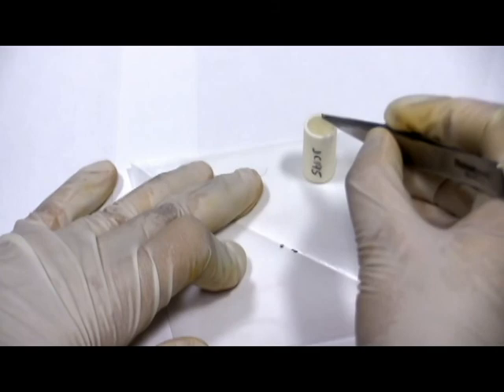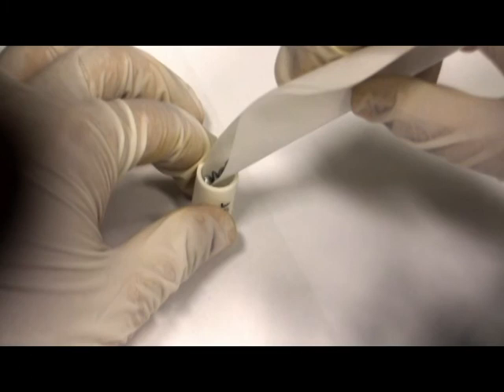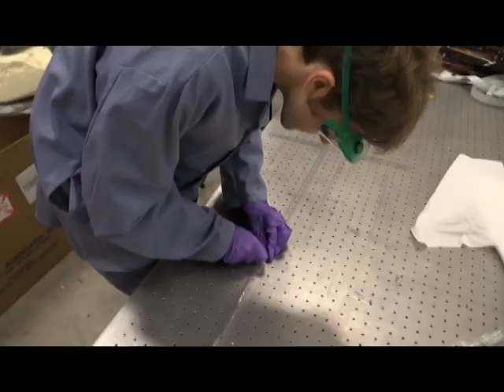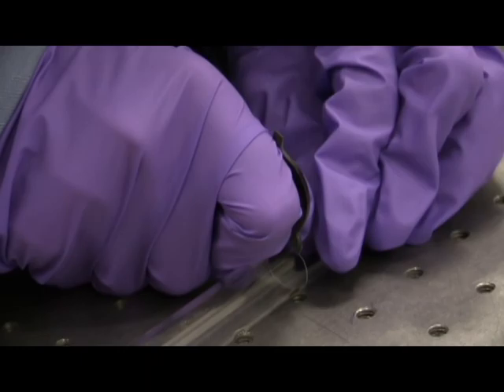The elements are stored in small, heat-resistant containers called crucibles. The crucibles then enter glass tubes which are placed in the furnaces for the growth. Starting from 4-foot tubes, the glass is first cut and then melted to the correct size.